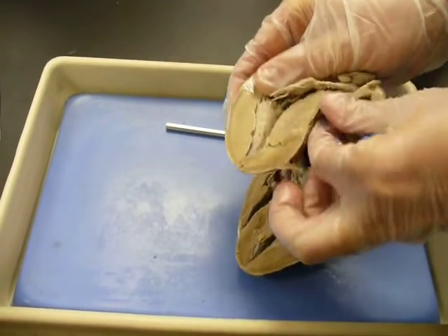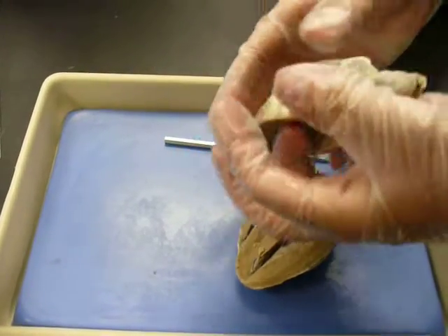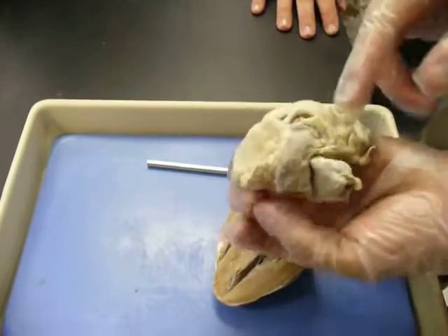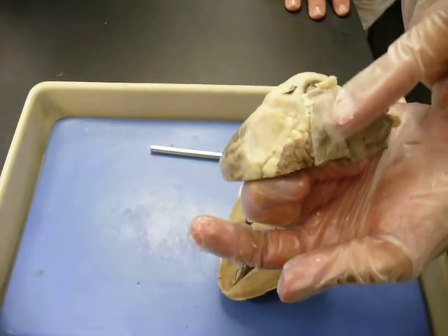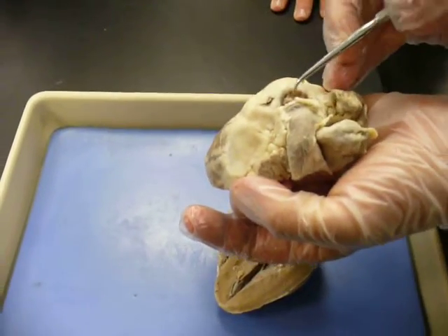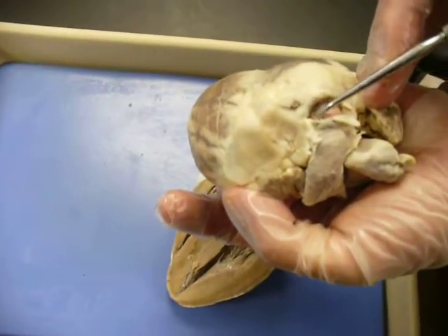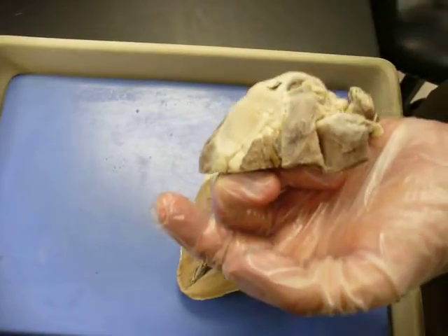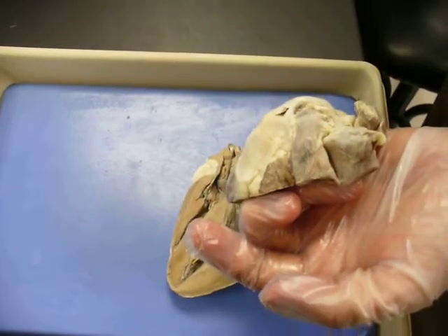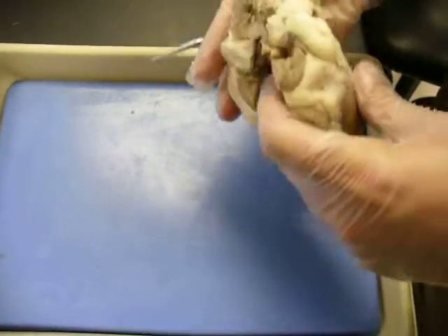It's a one-way valve, so it prevents the prolapsing of the chordae. Blood comes up then — it has nowhere else to go — and it's going to come up through this pulmonary trunk right here. This is your pulmonic semilunar valve. There's your pulmonary trunk carrying deoxygenated blood; it goes to the lungs, becomes oxygenated, and comes back through the pulmonary veins.